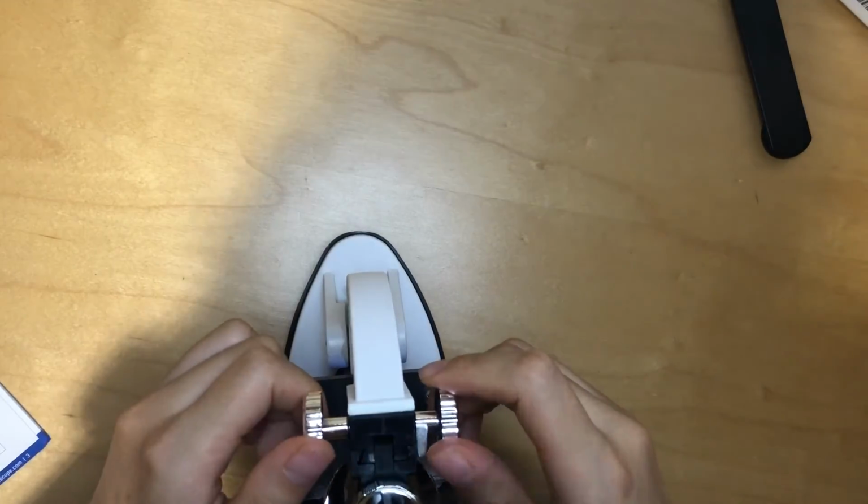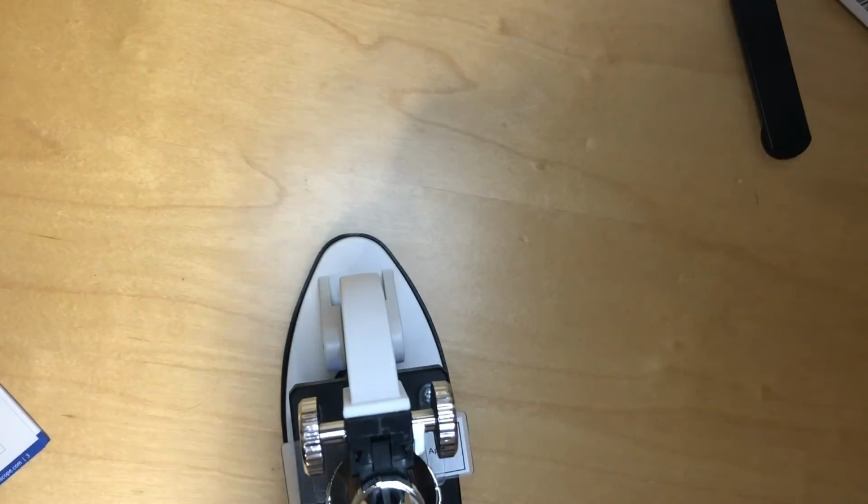Okay, so I probably want more magnification, so I turn counterclockwise. Oh, I like that. Wow. This makes me want to imagine things. Actually, it already does. I think we have some pretty impressive results. So, for example, you see that there are some pink flower-shaped things there. And this is due to the dye, of course.